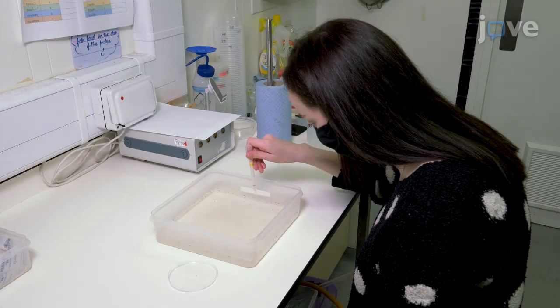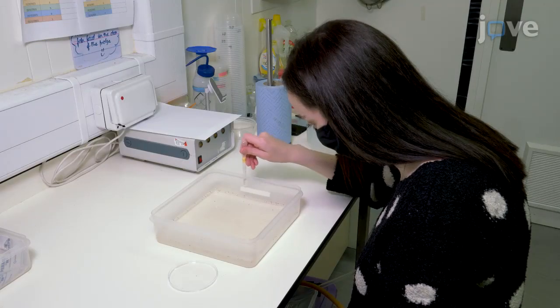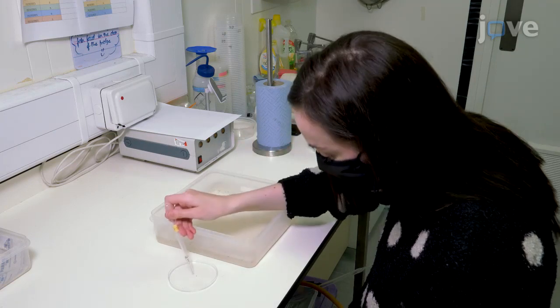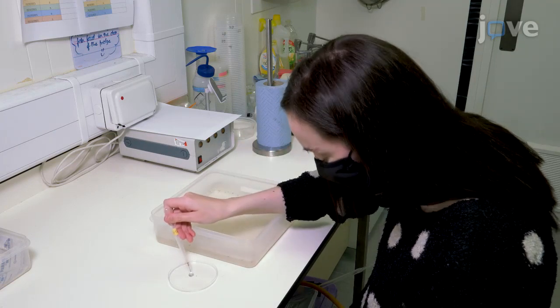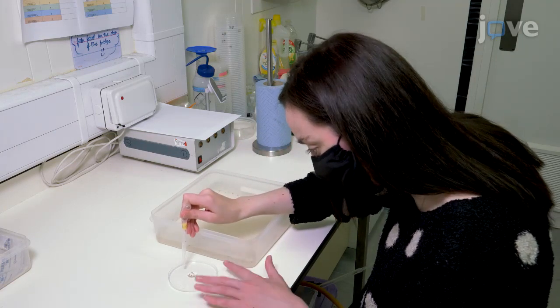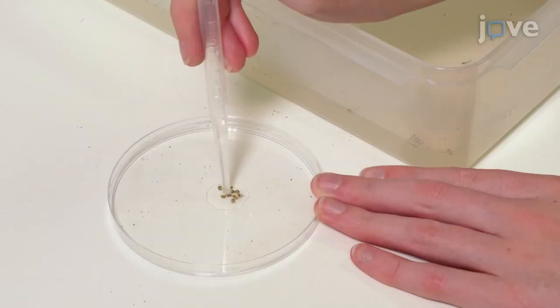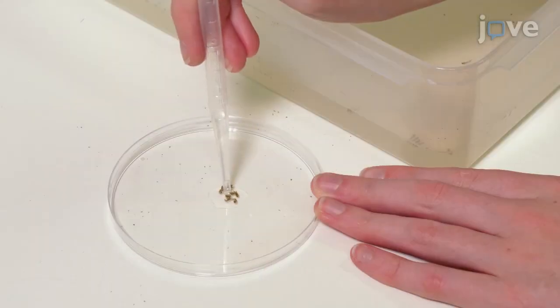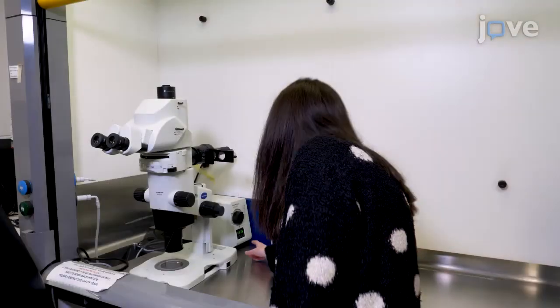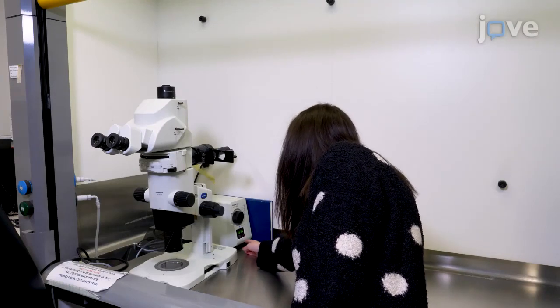Begin by collecting pupae using a 3ml plastic Pasteur pipette with the end cut off onto a clear flat dish suitable for use with a stereo microscope. Carefully remove most of the water around the pupae. Turn on the fluorescent bulb and allow it to warm up.